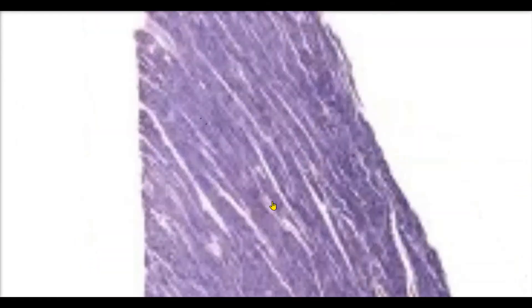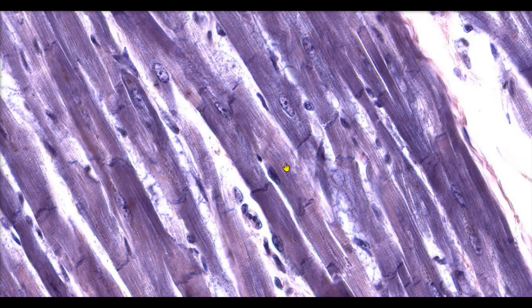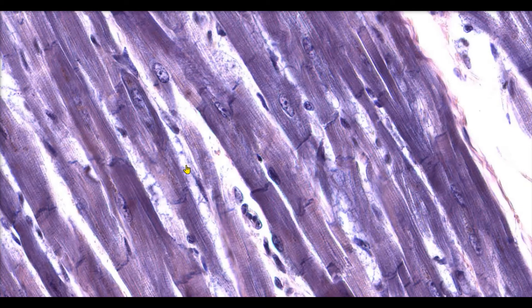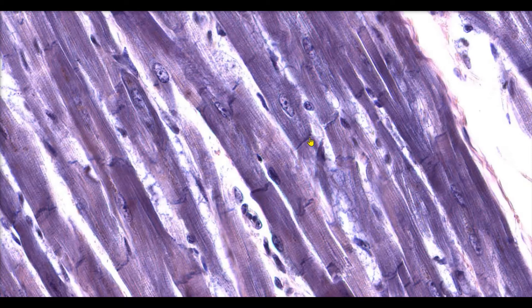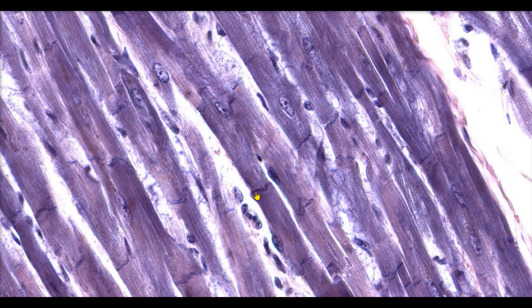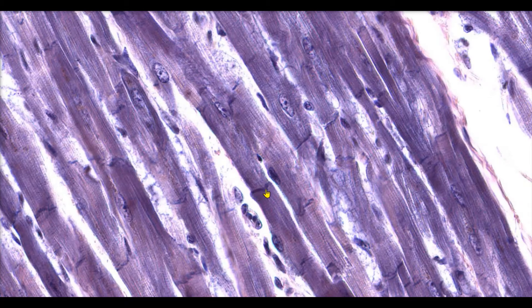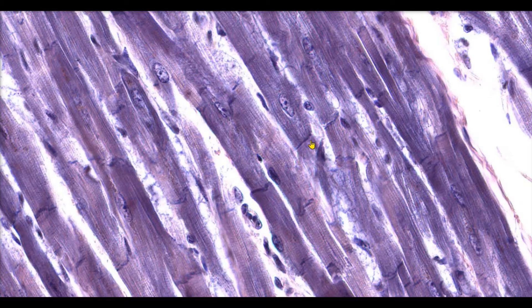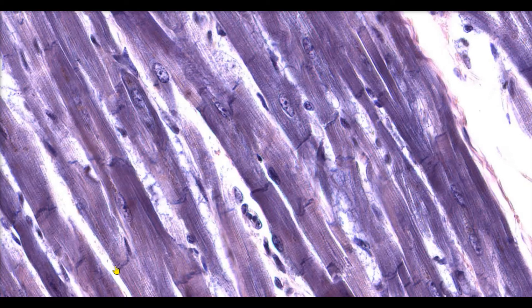Let's zoom in so we can get a better view of our cardiac myocytes. The first thing that we notice is that cardiac muscle cells are connected to one another by specialized junctions called intercalated discs. Intercalated discs appear as these very thick dark lines that sit between the cardiac muscle cells. These structures contain gap junctions that allow electrical signals to pass rapidly from one cell to the next. This is what allows the heart to contract as a unit.